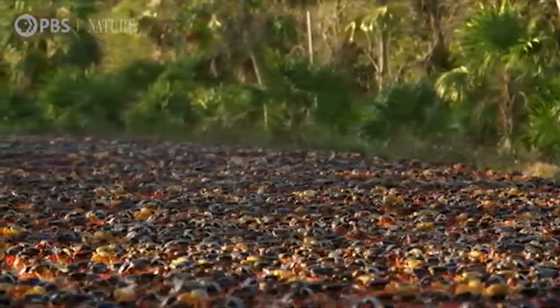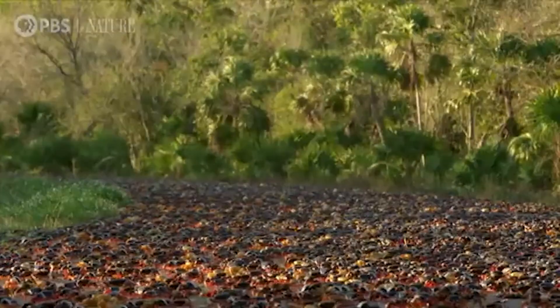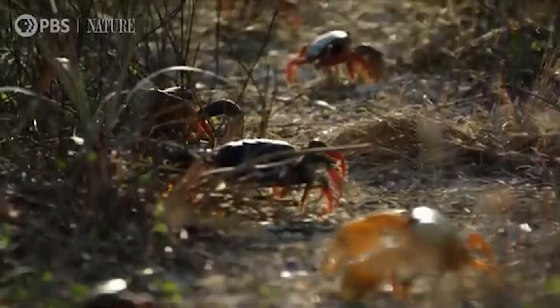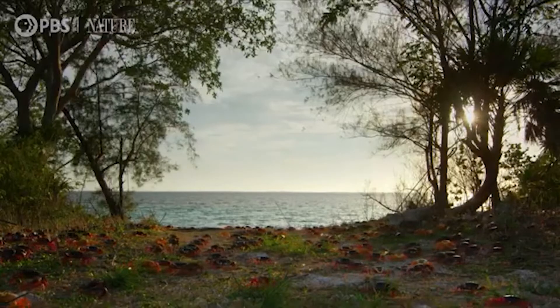Welcome to Divada Channel. Previously, for our episode on crustacean dissection, we tackled the external anatomy of the crab. Today, join me in dissecting the crab to learn more about its internal anatomy.